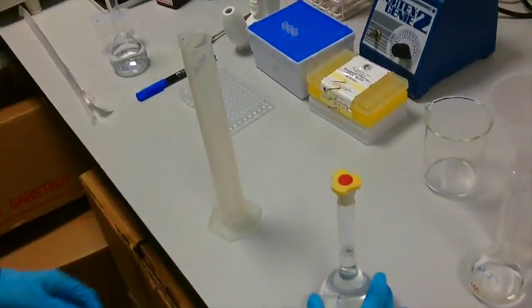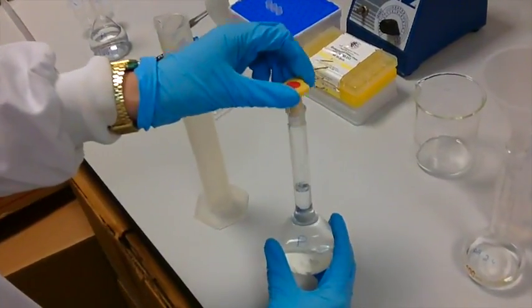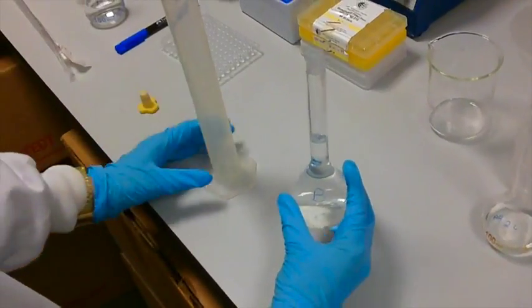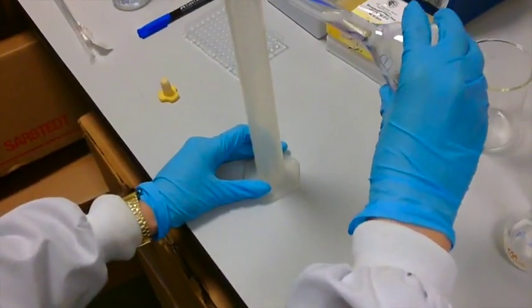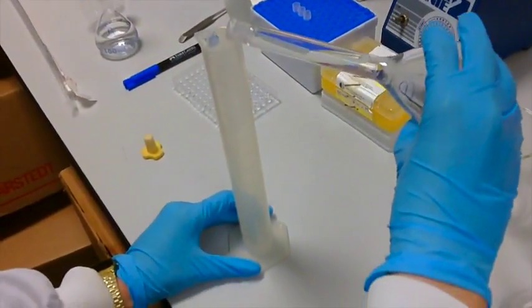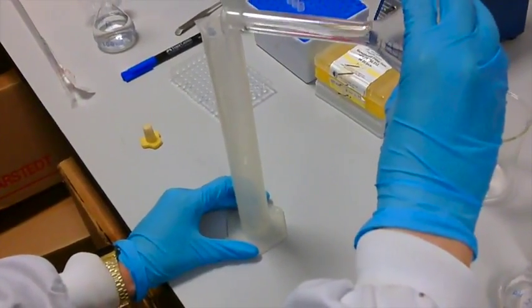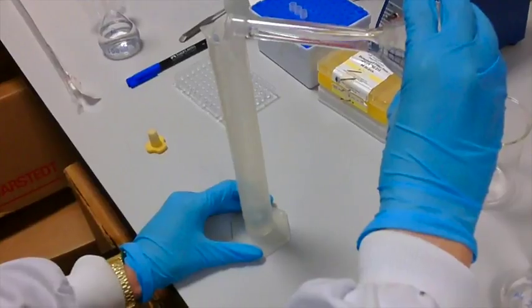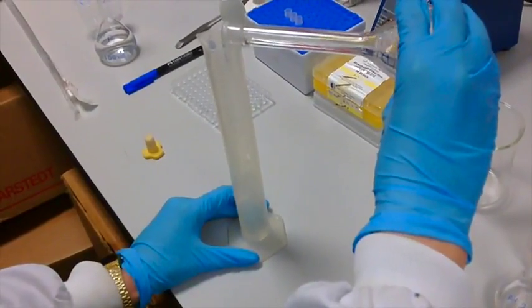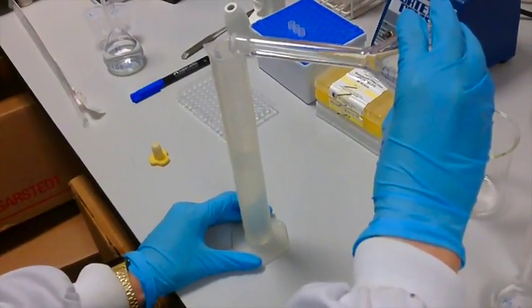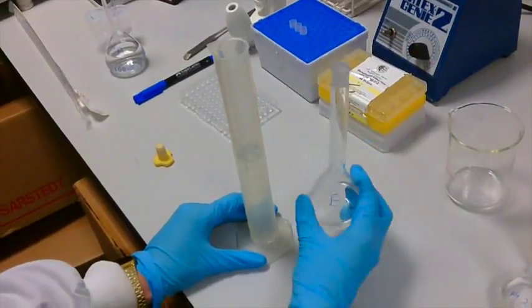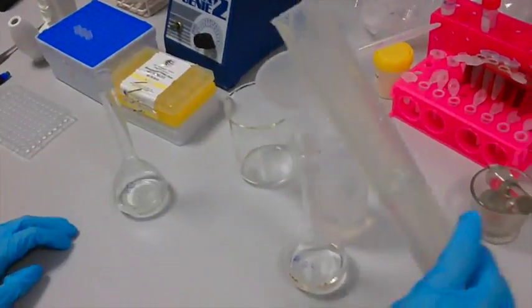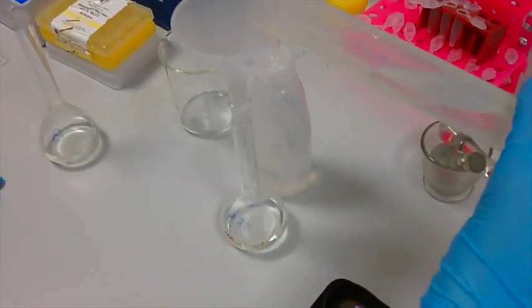After you've washed out the graduated cylinder and removed the washings, you'll now add the 65.4 mils of solution B, which is the 0.1 molar HCl. This is now added to solution A in the new volumetric flask.